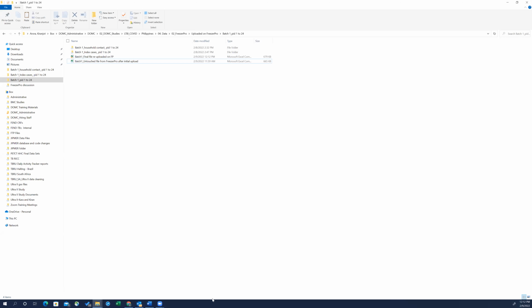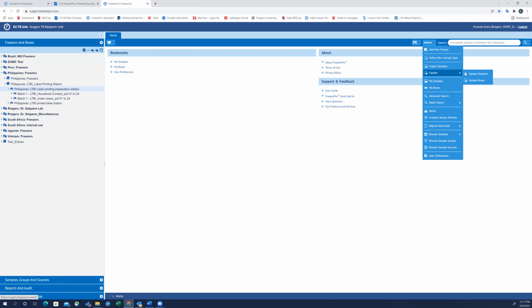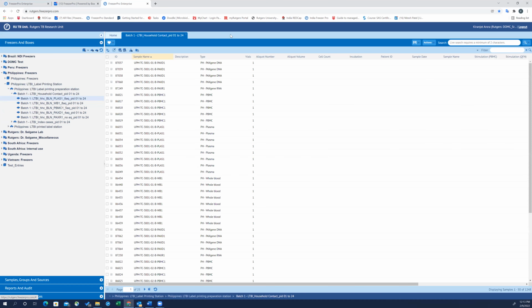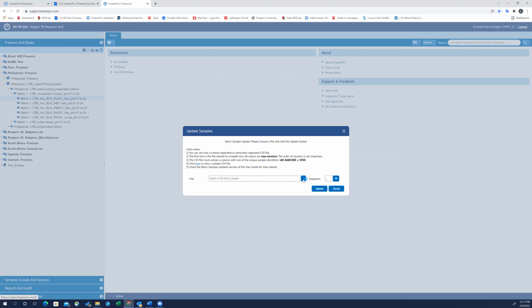close it, and go to the FreezerPro over here. Click on actions and update the samples. You won't click on import because every time you import the samples, that means the barcode is generated. In this case, since we had already uploaded the samples in the past and they are associated with a FreezerPro generated barcode, we cannot upload the samples again. We're not going to import it again. We're just going to update some information about the sample.